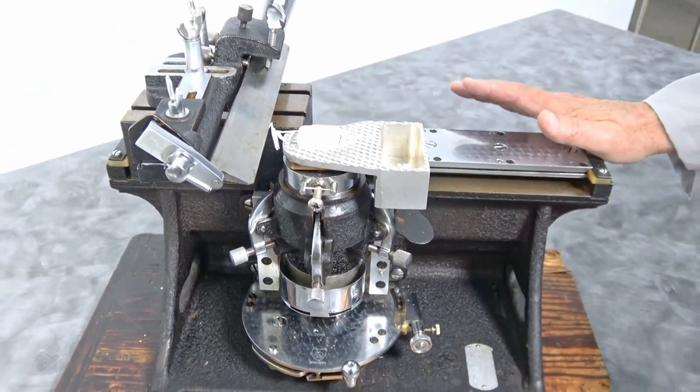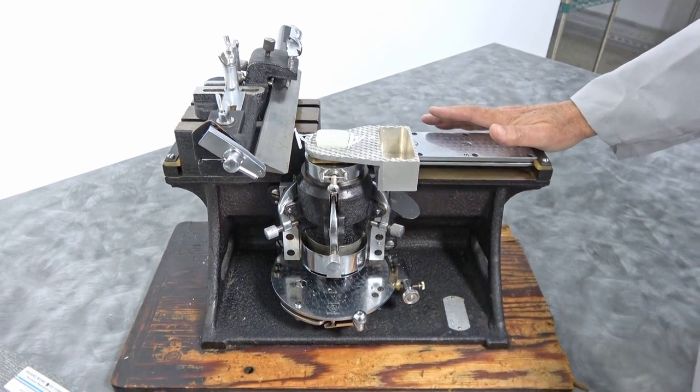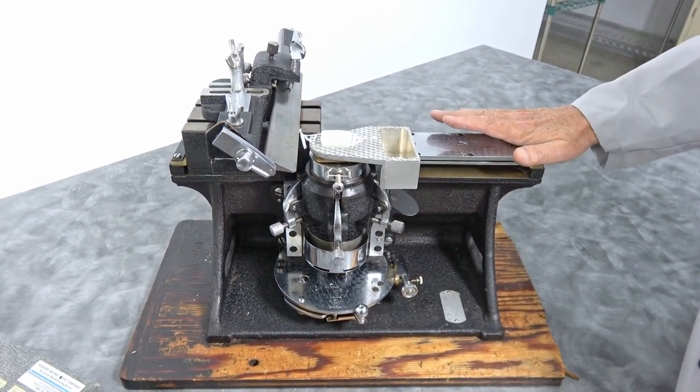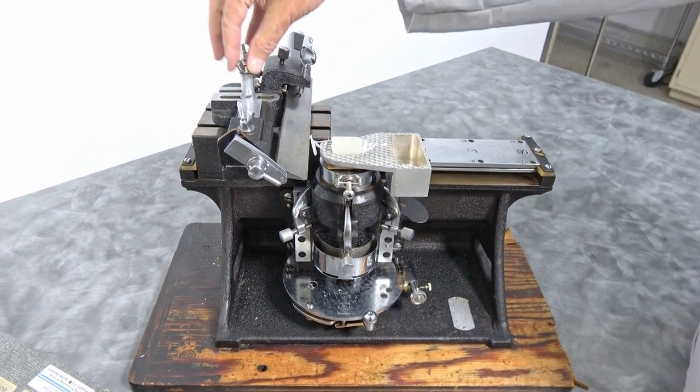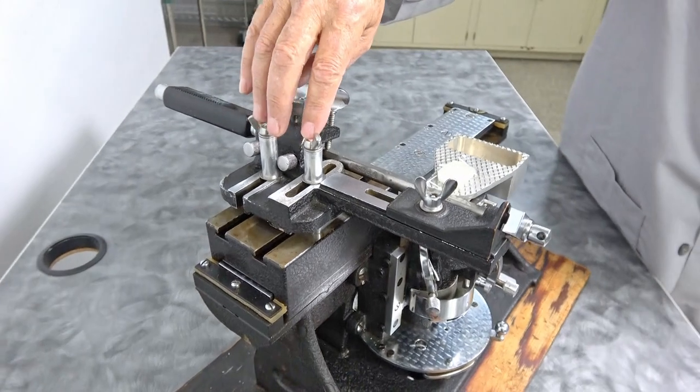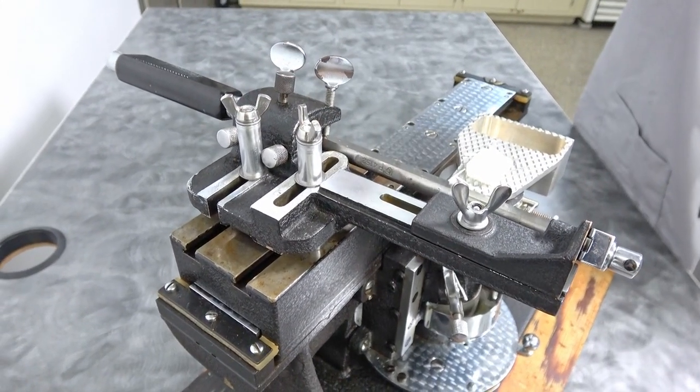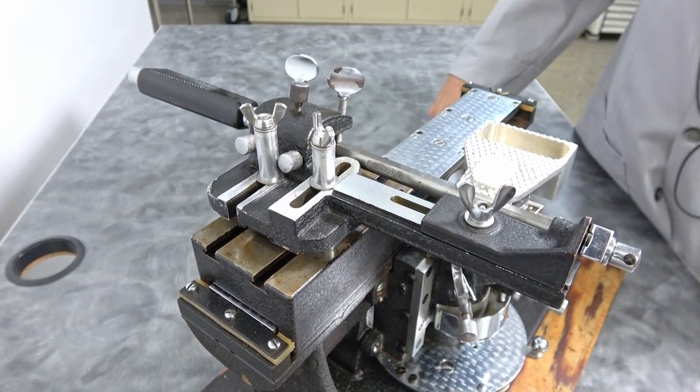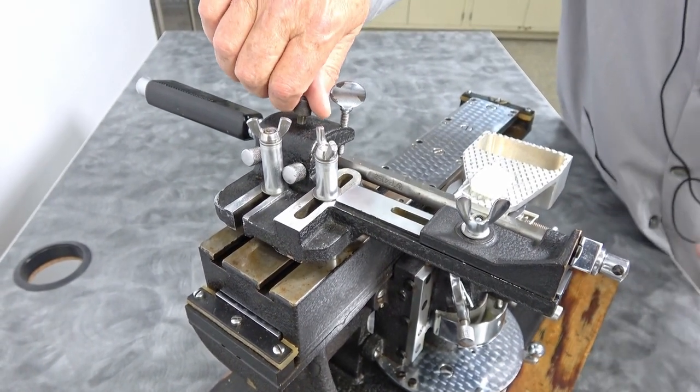This is not all original equipment. We did have to manufacture some items which was mostly these two knobs here. There are some videos of this, not one of these running but with the proper knobs. But a nice little system, fully working.